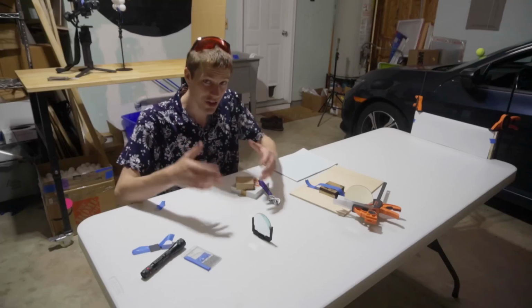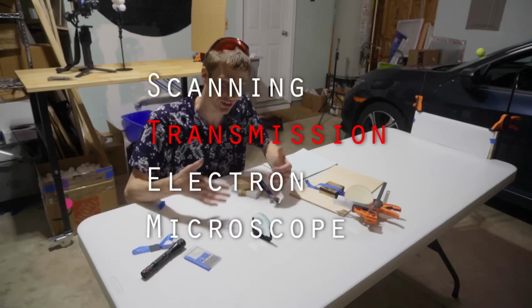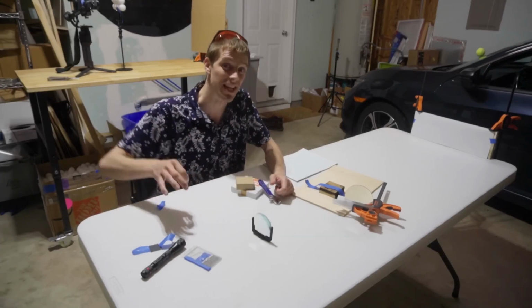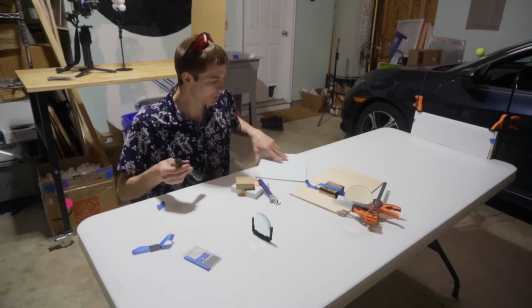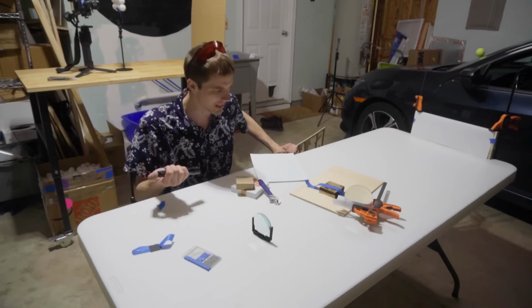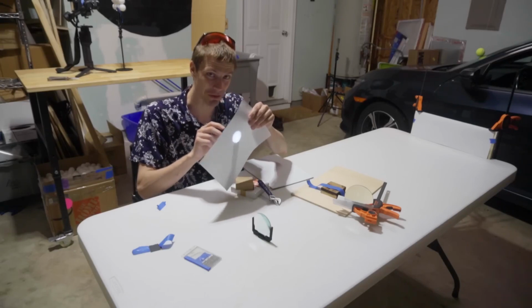Now, in order to actually blast electrons all the way through a sample of material in order to image its atoms, that sample needs to be really thin. Imagine trying to shine a light through a piece of paper. You can see some light through a piece of paper.